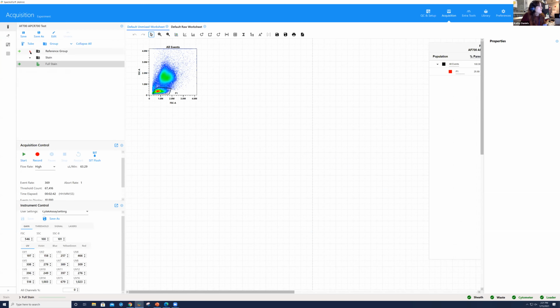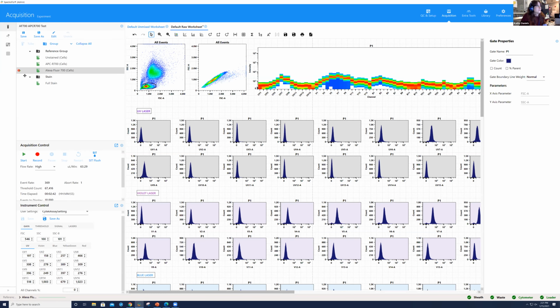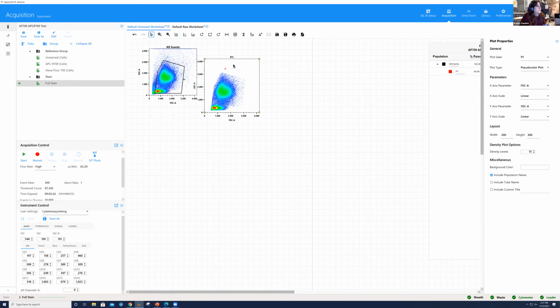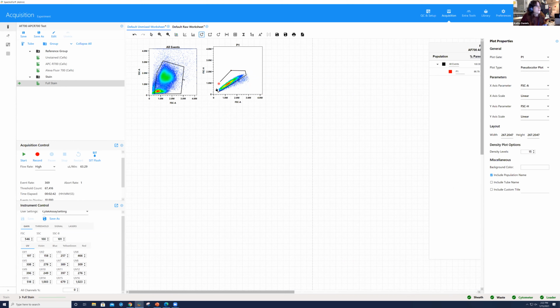So again, for this experiment, I ran the unstained, APCR 700 single color, Alexa 700 single color, right? So if I look at all of these, we already had these samples run, okay? And then I can look at the fully stained for this sample to see what it looks like. Now here, because it's a combination of CD4 and CD14, I'm going to set this scatter gate to include this population of monocytes right here before proceeding. So I'm not going to focus just on my lymphocytes anymore. We're looking at the whole population of cells. We'll look at our singlet gate. I'm going to set a polygon, again, for our singlets, okay?